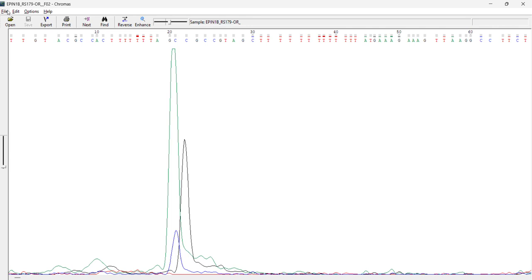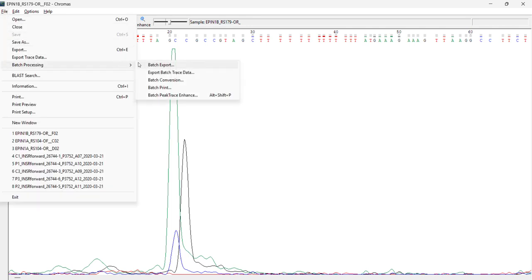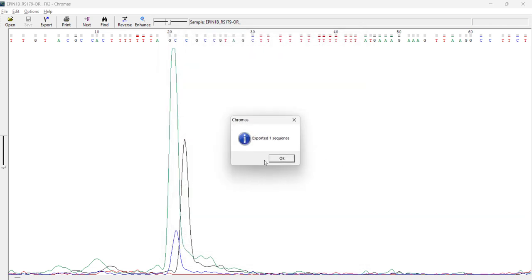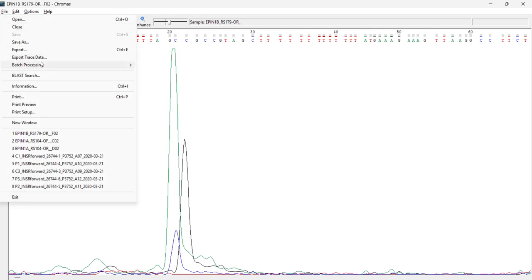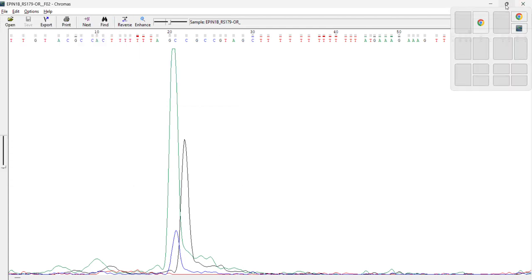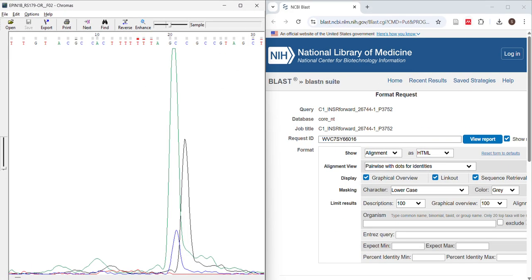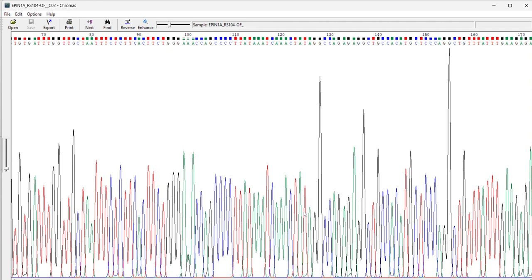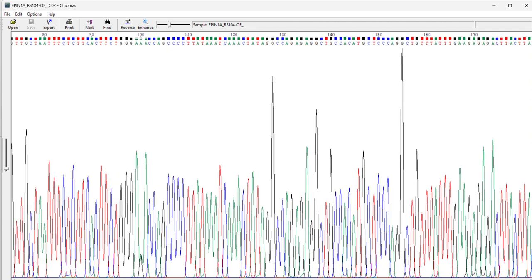So this way we can check, and if you want me to open two files at a time, we'll try batch processing. Okay, maybe this one is already open. This one I'll open. Okay, already exported. So you can check it and trial. This is free software, so you can download it right now and start working on that, right? Or what you can do is you can always do this as well, right? So this is the better version of the results.